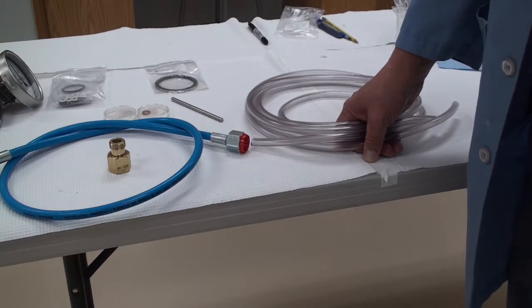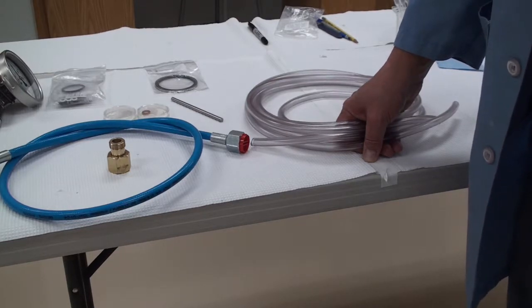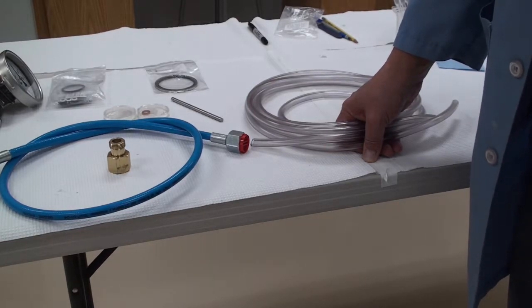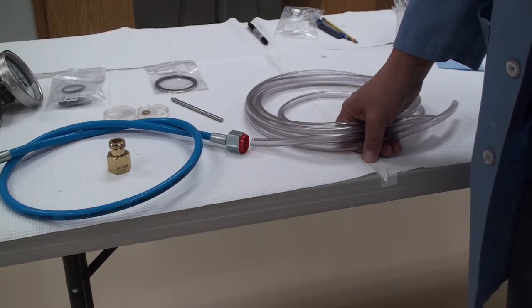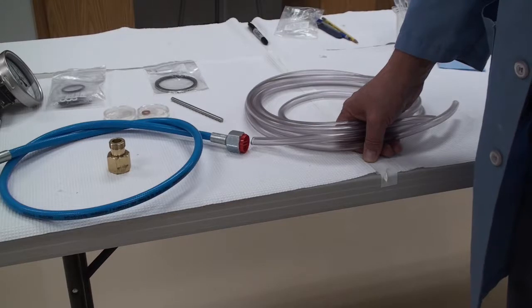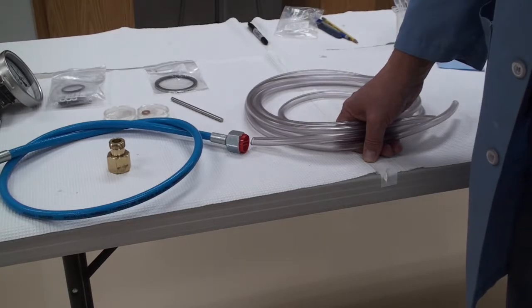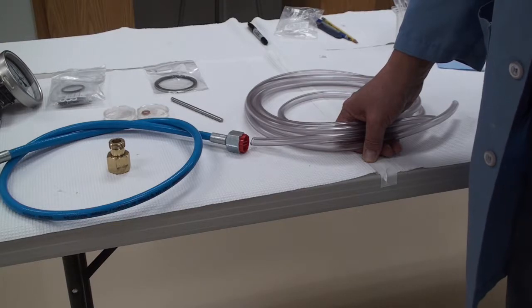Some people in some locations can use tap water. But remember the E-3100 has a large mass and requires quite a bit of heating and cooling capacity to reach plus 40 and plus 5 degrees Celsius temperatures needed for optimal operation.